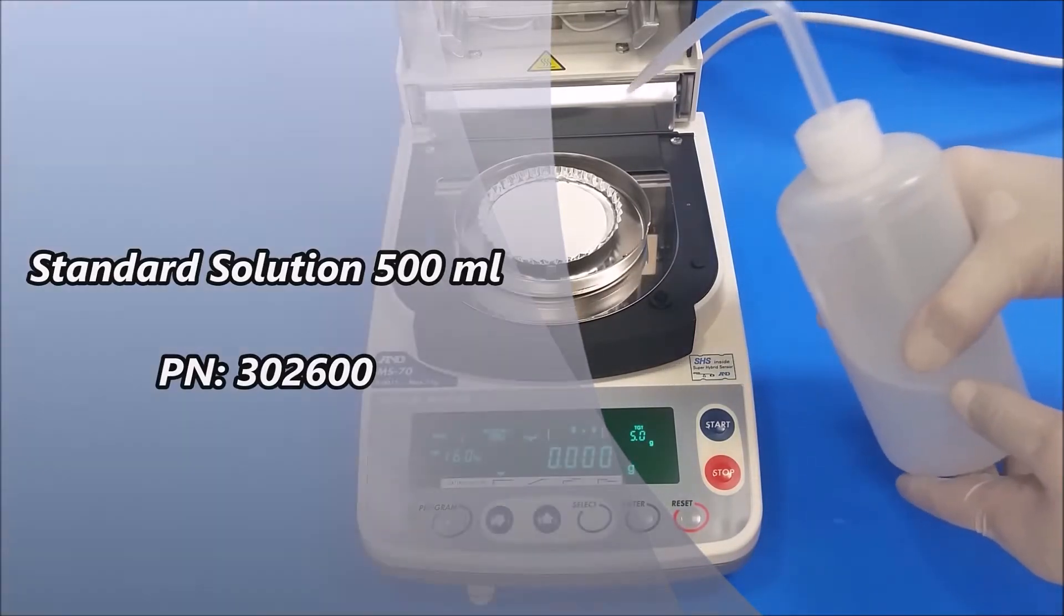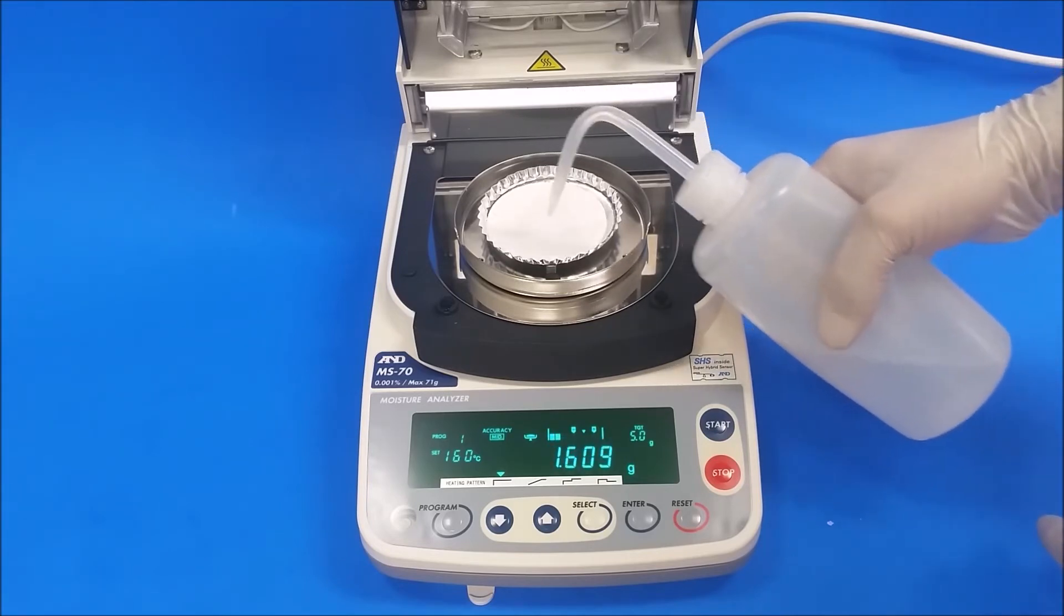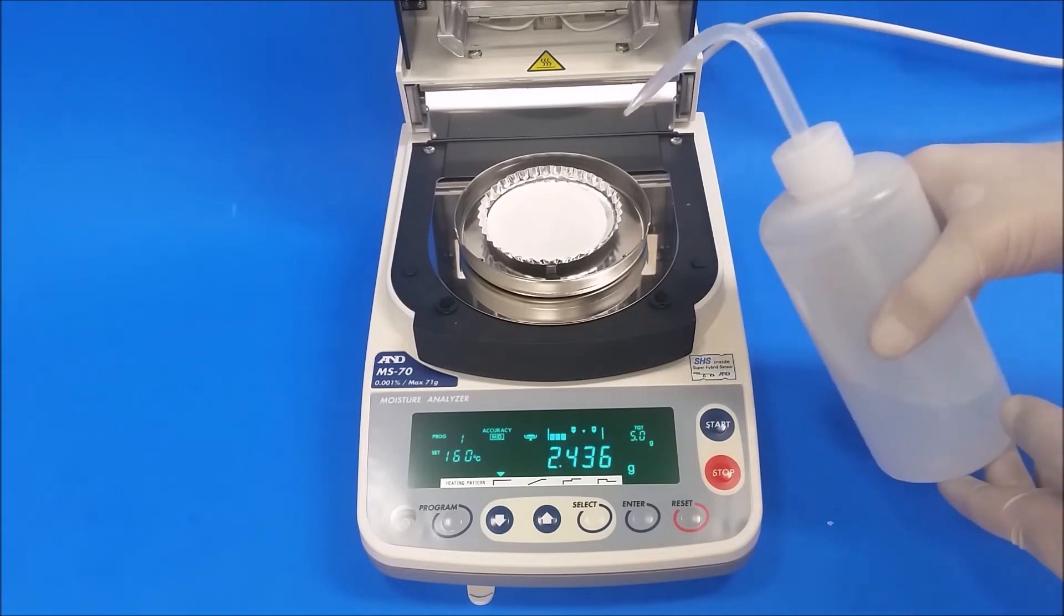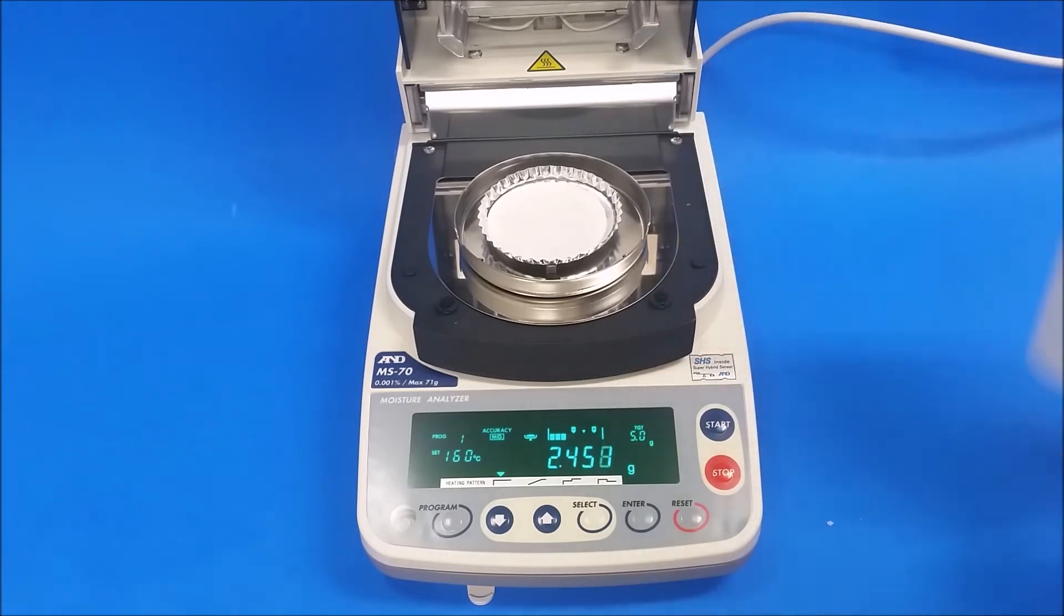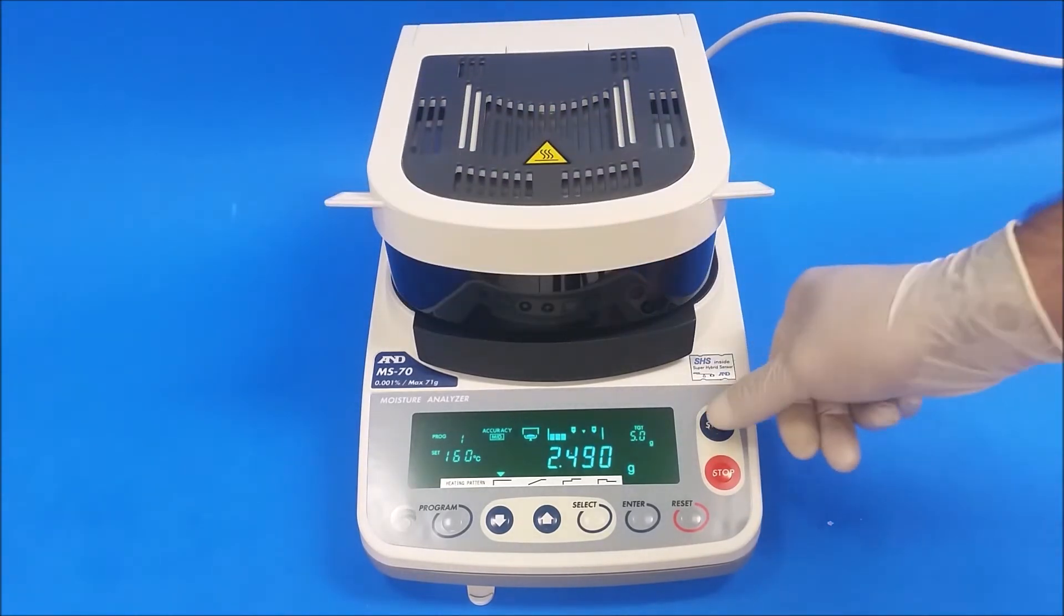Next step I'm gonna add my standard solution. We're gonna add about 2.5. That's good right there. Next I'll just hit the start button.